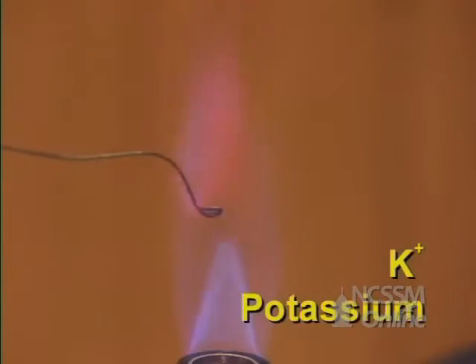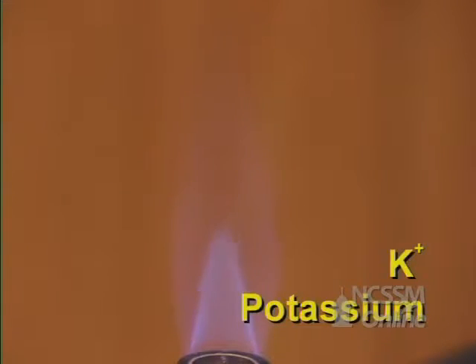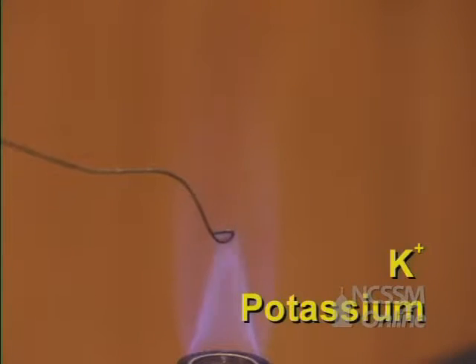Potassium. It should be a lavender color.